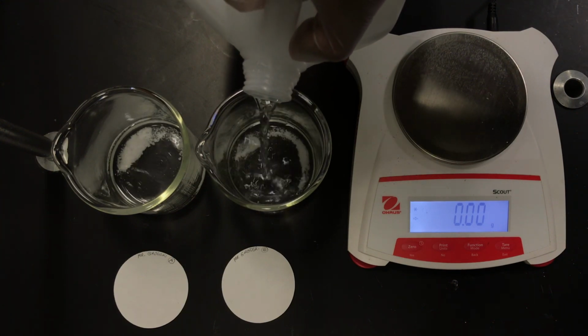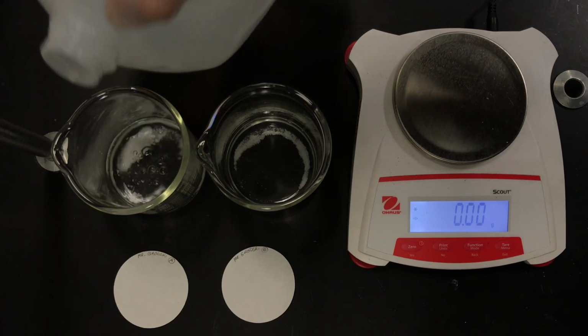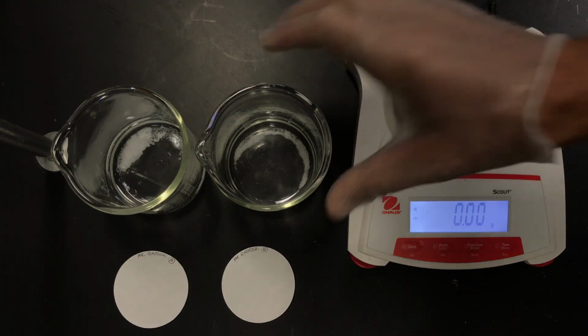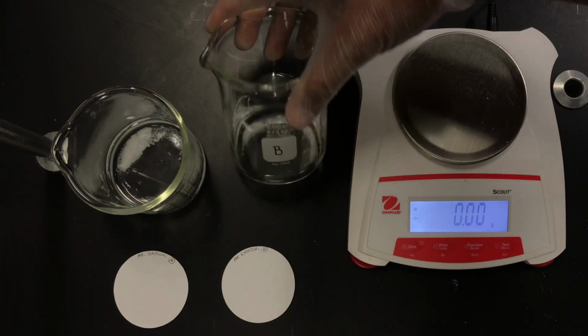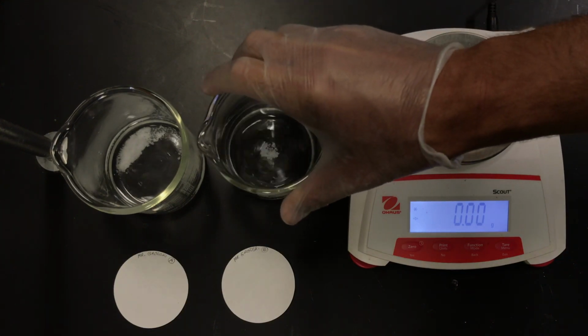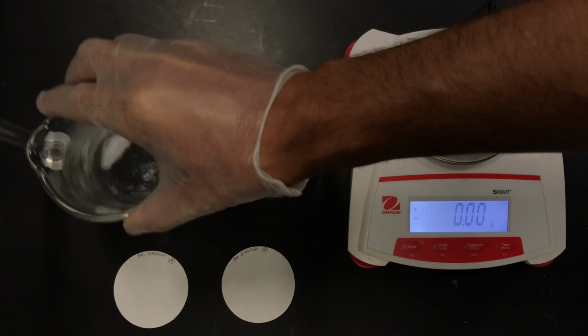The amount of water I'm adding is not important, since this lab is all about obtaining the moles of the precipitate that will give us insight of the moles of this compound that we started with. So the amount of water is clearly not important here. The idea is that we're going to dissolve all the moles of the carbonate ions. The carbonate ions are what we're after.